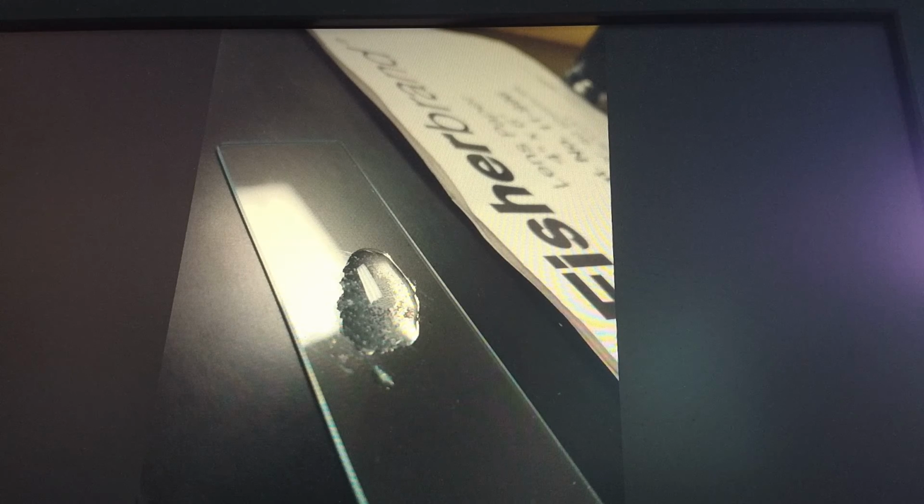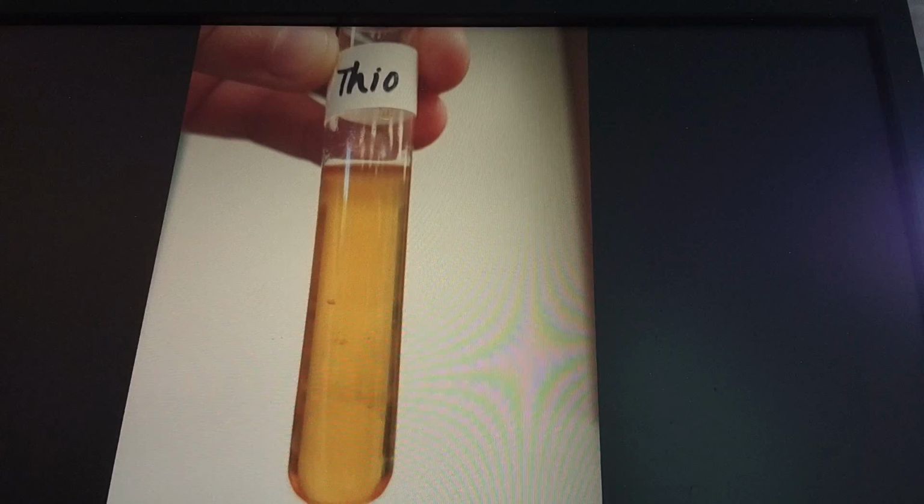The test for catalase is differential and tests for the presence of the catalase enzyme. In order to do this, we placed a small amount of our unknown onto a slide and added hydrogen peroxide to it. If bubbles were formed, then the test was positive. Since we were pretty sure that our unknown was E. coli, we knew that the test should have been positive, and it was. This reassured us that we were correct.